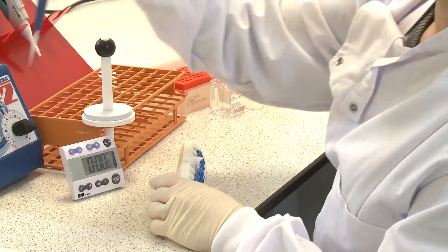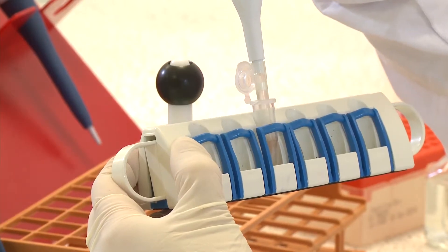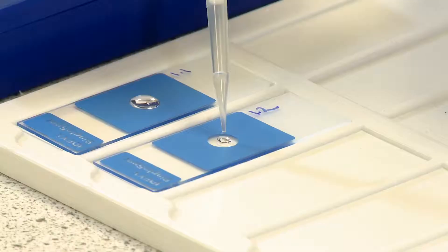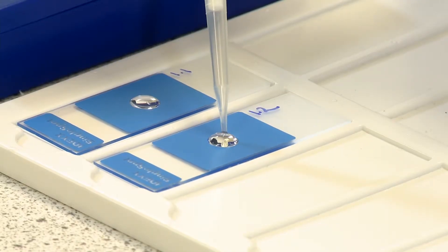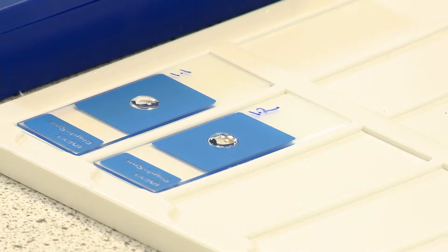Repeat the dissociation a second time, transferring the second hydrochloric acid volume to a separate slide. It is recommended that samples are allowed to air dry at room temperature overnight. However, if using a slide warmer, ensure this is set no higher than 35 degrees to prevent excessive crystallization and reduced recovery. Once dry, the samples should be stained.